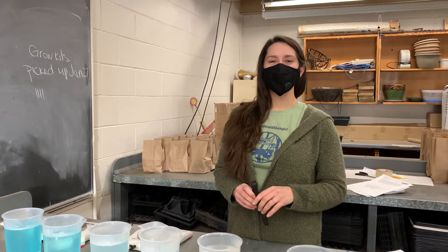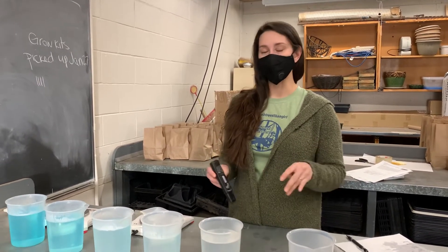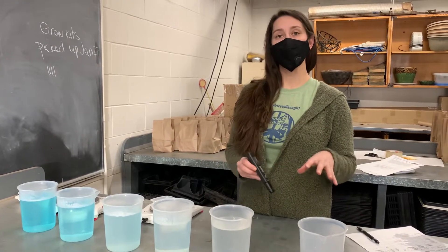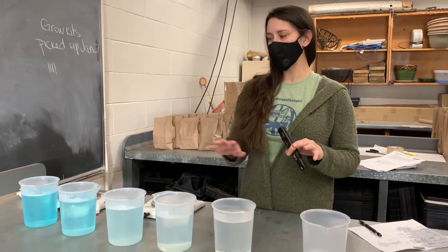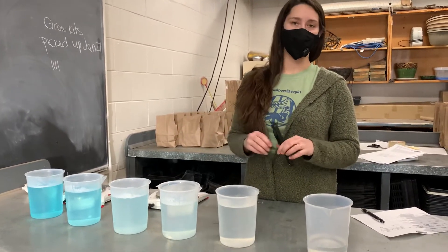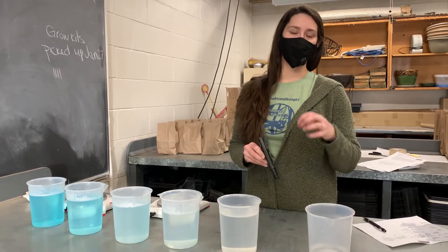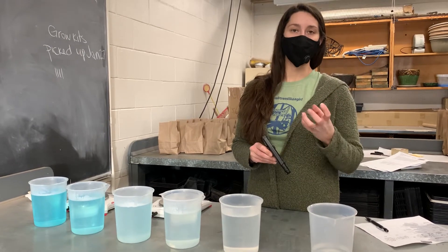Hey everyone. This week we're going to start looking at fertilizer, and the first thing we're going to do is figure out some toxic levels. What we've got measured out here is varying levels of 11-41-8 fertilizer, which is a good fertilizer to use as our seedlings are in the establishment phase because it helps support their root development.